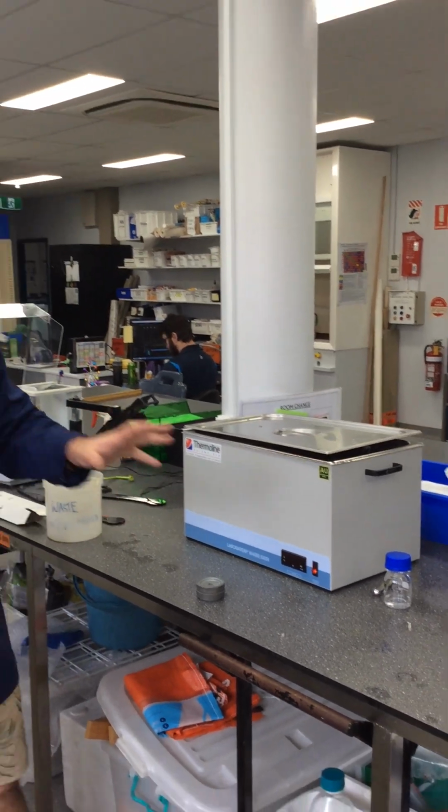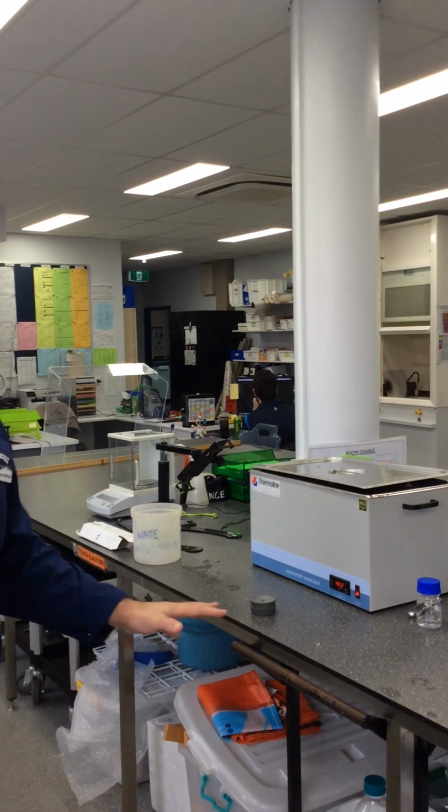It's a little warmer than that because I filled it up with hot water, but that's okay because it has acclimated our solutions to 40 degrees, which is what we want. Okay, now we've got all our equipment set up. Now it's just a matter of conducting the experiment.